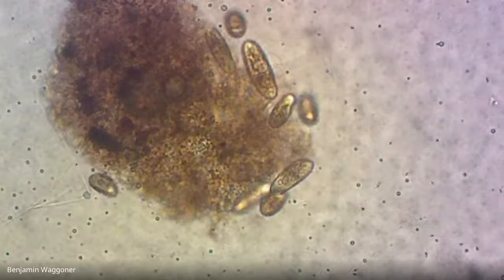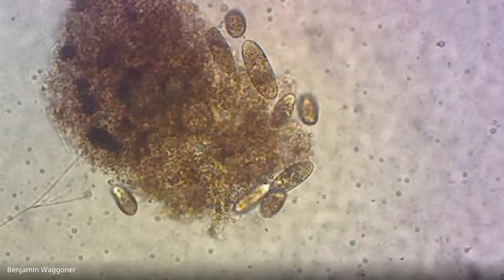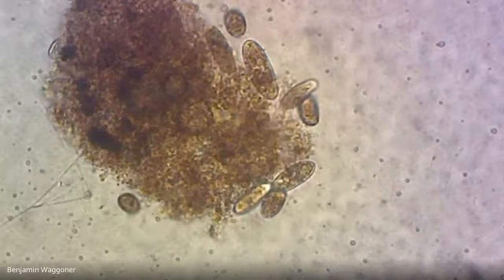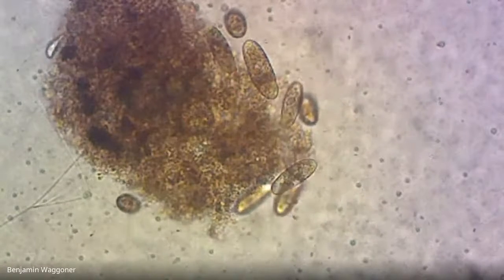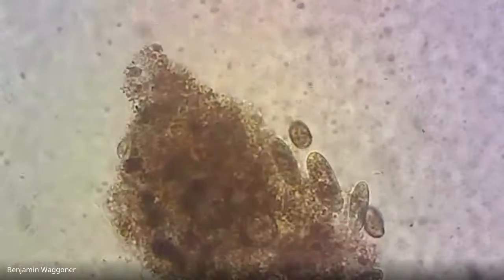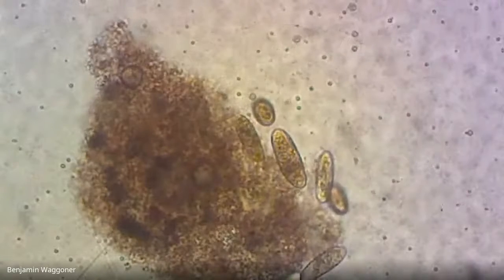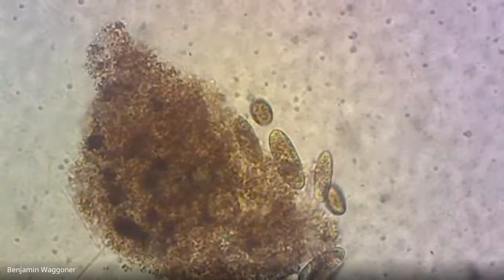If you look very closely, it looks to me that maybe two-thirds of the way towards one of the ends, there's a little dent, a little indentation. That's probably the site of the cytostome and maybe the peristome as well. You can actually see some of the effect of the cilia by seeing the way that some of these bacteria are kind of getting flung around.